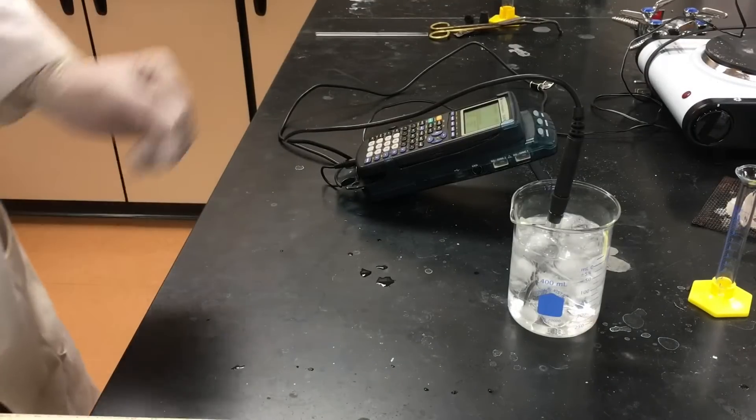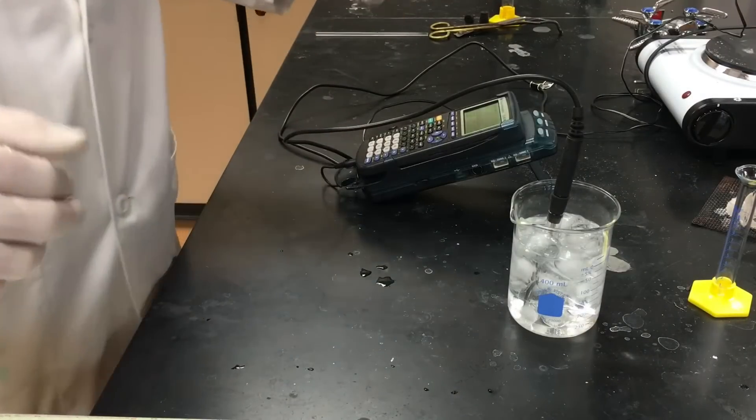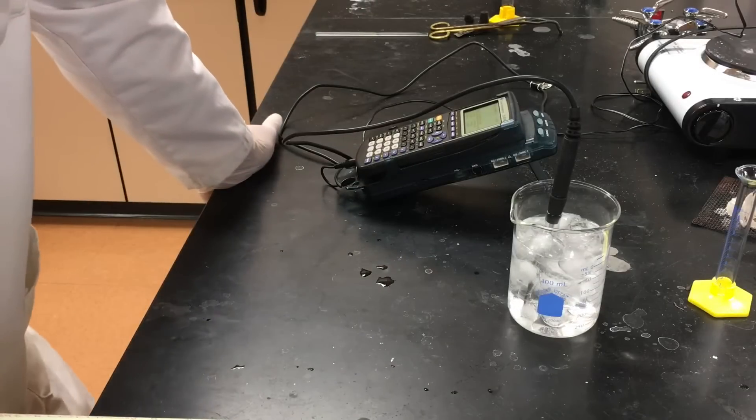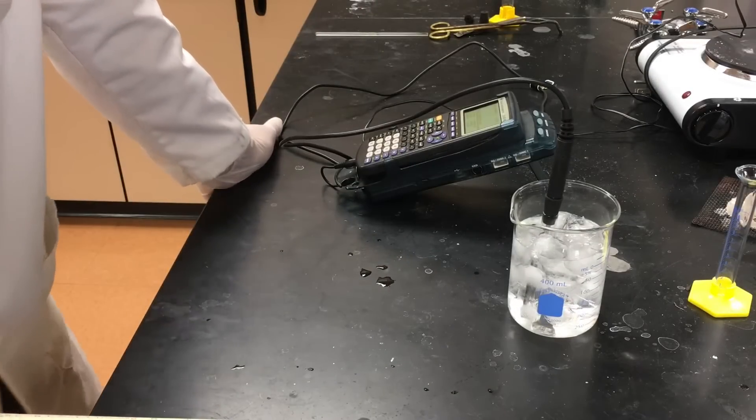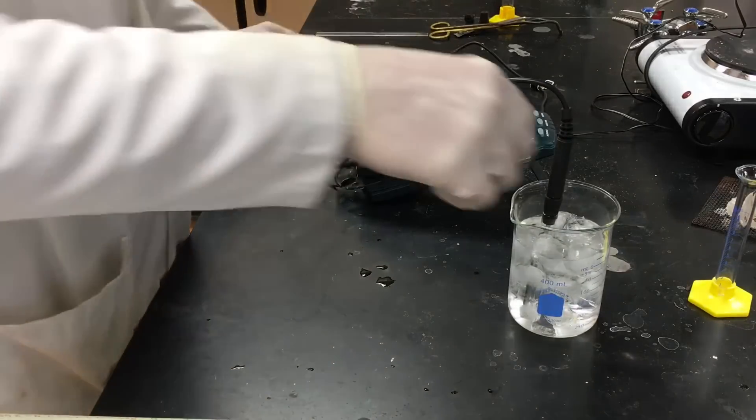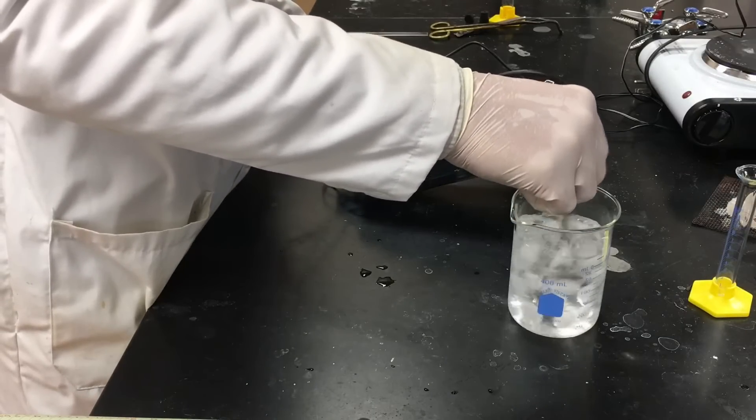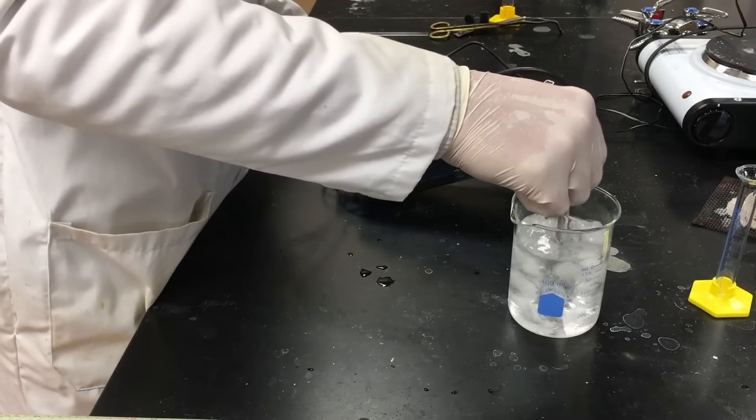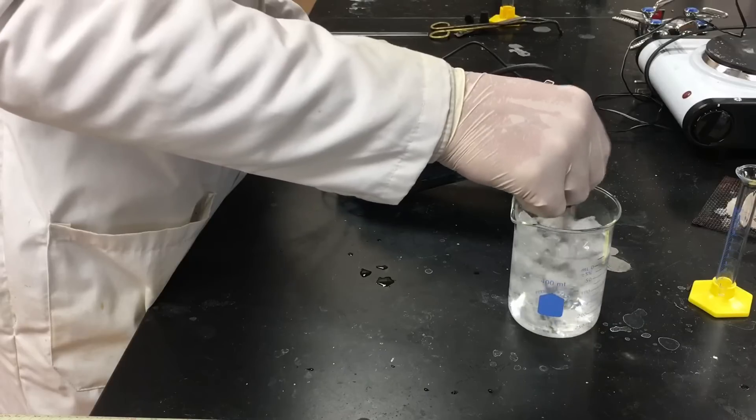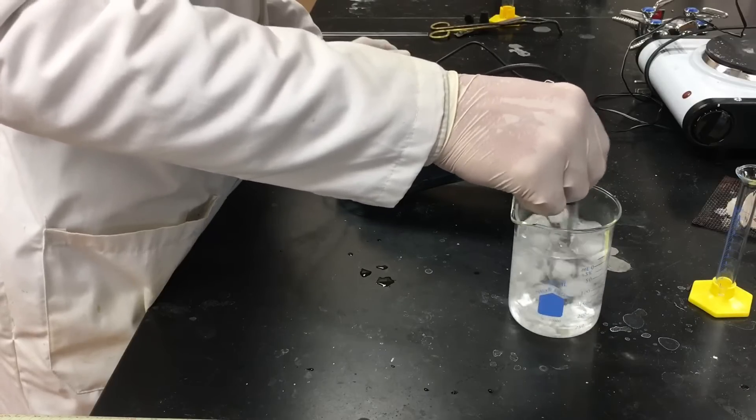Now we have to put the sample in the ice water. When the temperature gets to about 13 degrees, 12-13 degrees, we're gonna record the temperature every five seconds. We're already at 12.5.